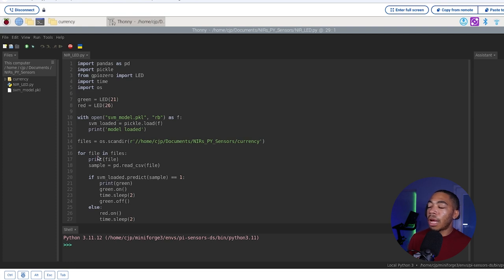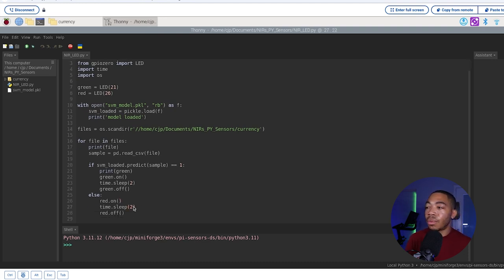Next, in this for loop here, I'm going to loop through my file list. I'm going to save that as sample, and then I'm going to run that sample through my model, where if this model output is 1 or inlier, it's going to light up green, wait 2 seconds, and then turn the green light off. Otherwise, it's going to light up red, wait 2 seconds, and then turn the red light off.